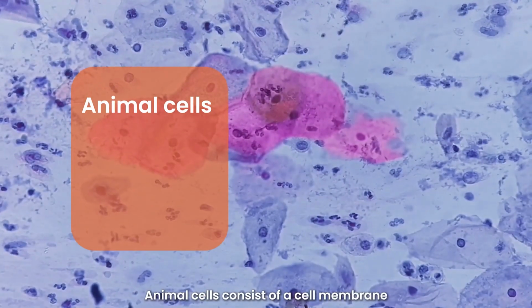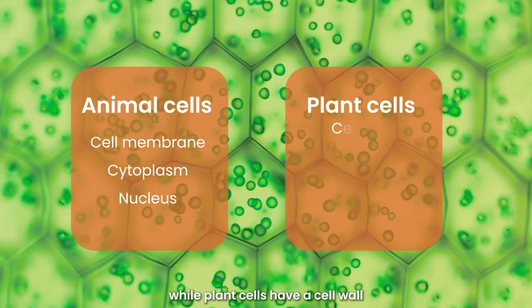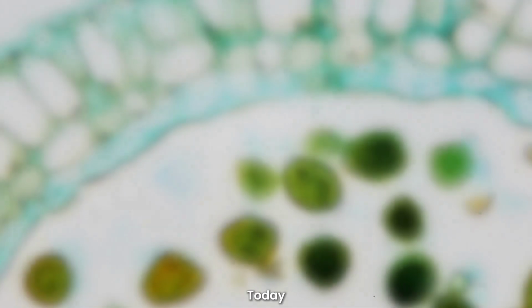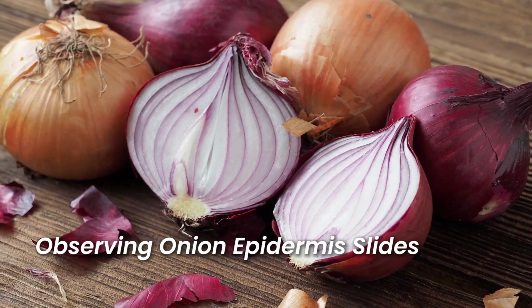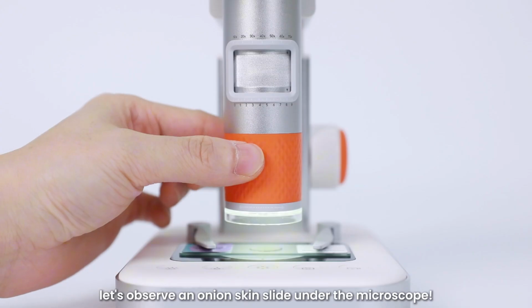Animal cells consist of a cell membrane, cytoplasm, and nucleus, while plant cells have a cell wall, cell membrane, cytoplasm, and nucleus. Today, we're going to explore the structure of plant cells. Observing onion epidermis slides. Now, let's observe an onion skin slide under the microscope.